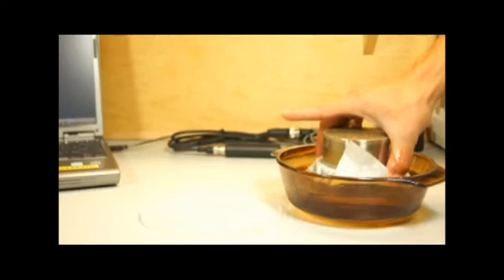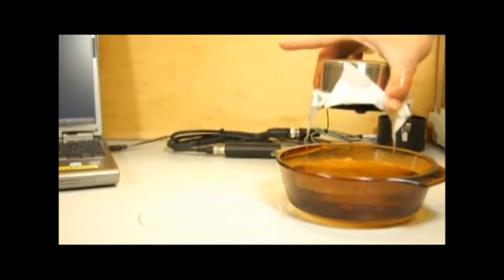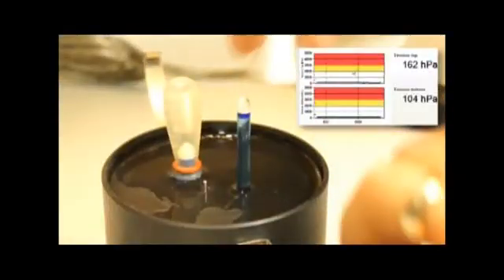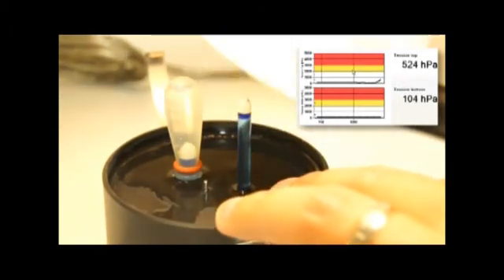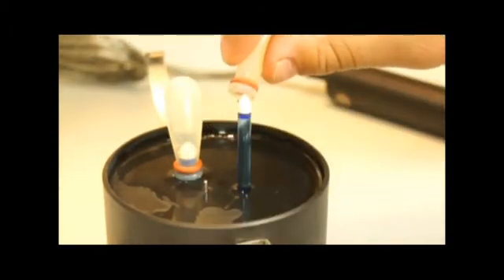Back to the soil core. Remove it from the water and let it drain freely for 5-10 minutes. As it's draining, you can check the tensiometer's response in TensioView by gently touching the tips with a paper towel. Remember to wet them back up again and re-cap.